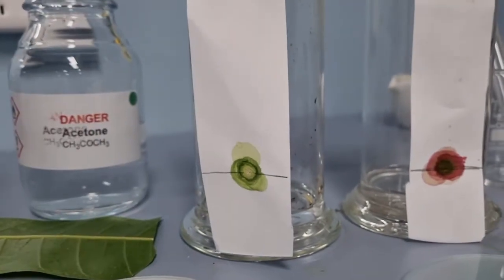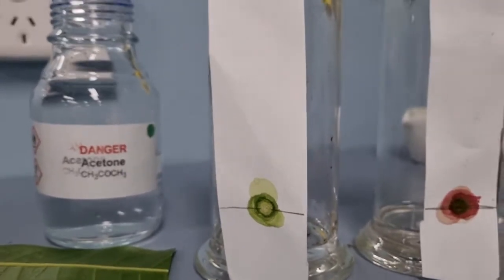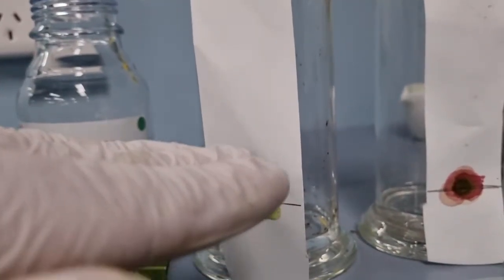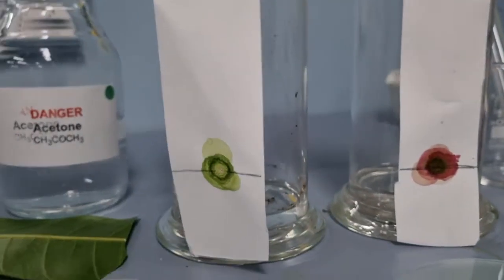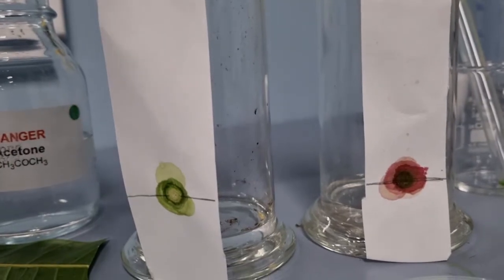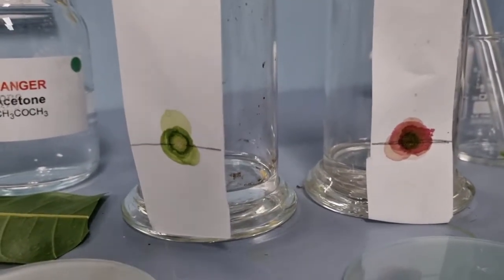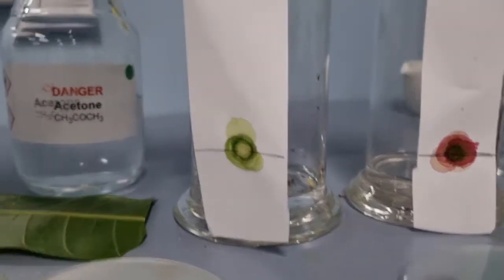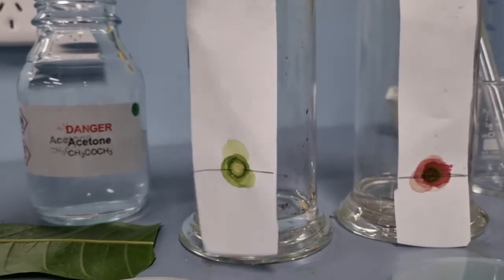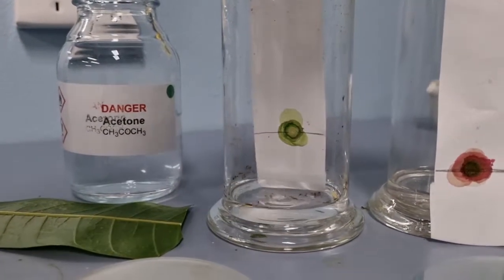So let's say it contains chlorophyll A and maybe chlorophyll B plus maybe some beta carotene, then we should start to see those different pigments separate as they move up. Likewise, if this, I can see that there's red, so that would indicate to me there's probably anthocyanin in there, but perhaps there is beta carotene as well, that yellow pigment, and even though it looks red, I imagine there's probably some chlorophyll in there. So how are we going to do that? Well, let's just put our chromatography paper into the acetone solutions.